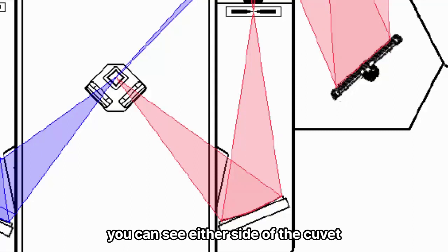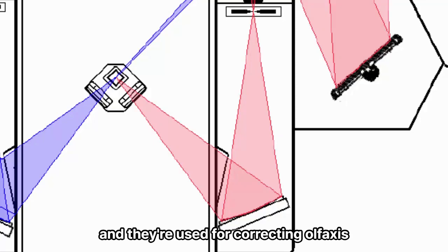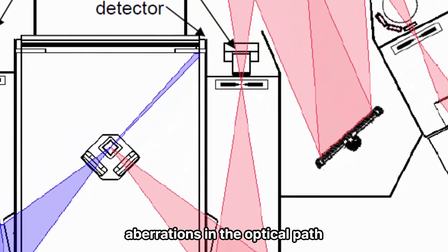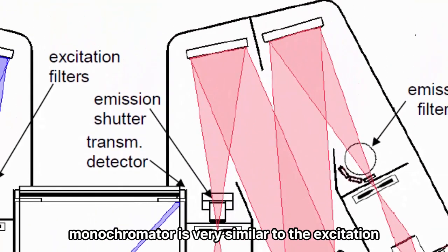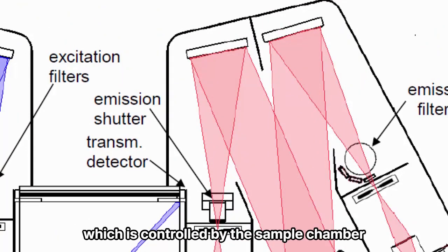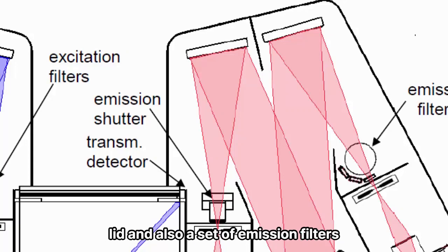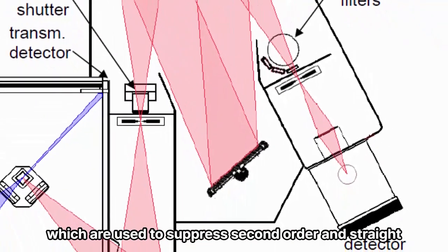The two mirrors you can see either side of the cuvette are toroidal mirrors, and they are used for correcting off-axis aberrations in the optical path. The emission monochromator is very similar to the excitation monochromator. It has an emission shutter which is controlled by the sample chamber lid, and also a set of emission filters which are used to suppress second order and stray light effects.